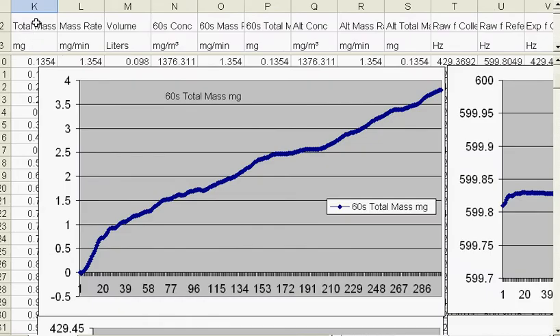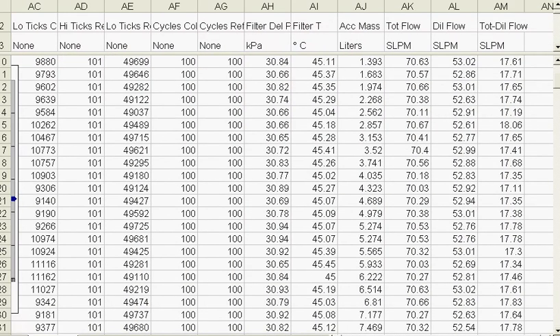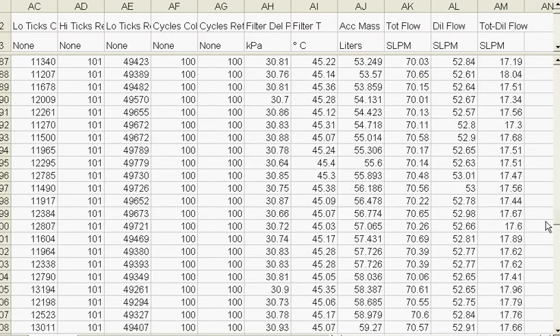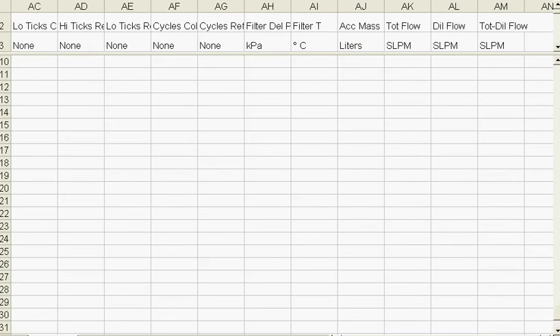And now I have each one of these columns. We have the total mass, mass rate, volume, liters. All of these variables are indicated and collected. They go all the way up to AM. Also, they go to the very bottom, and we have the raw data of the device.